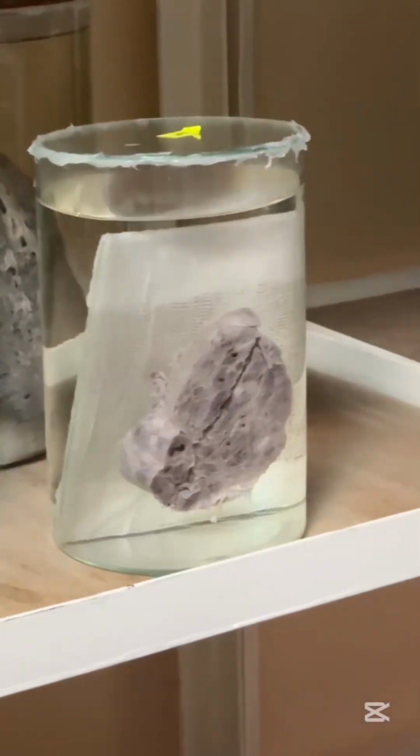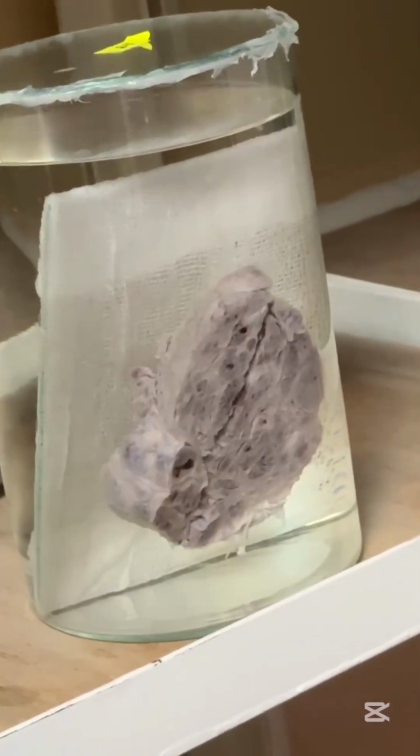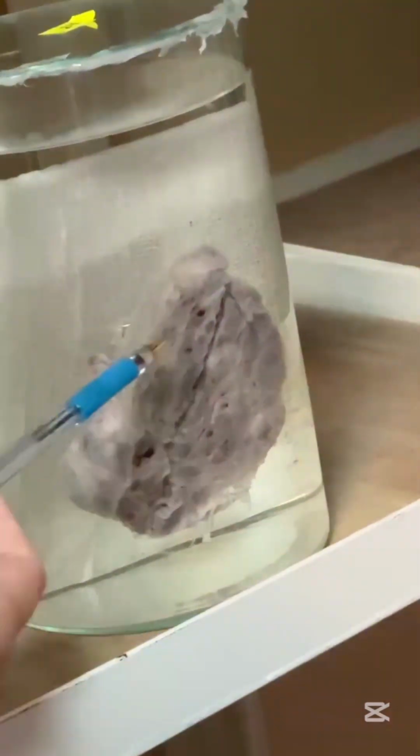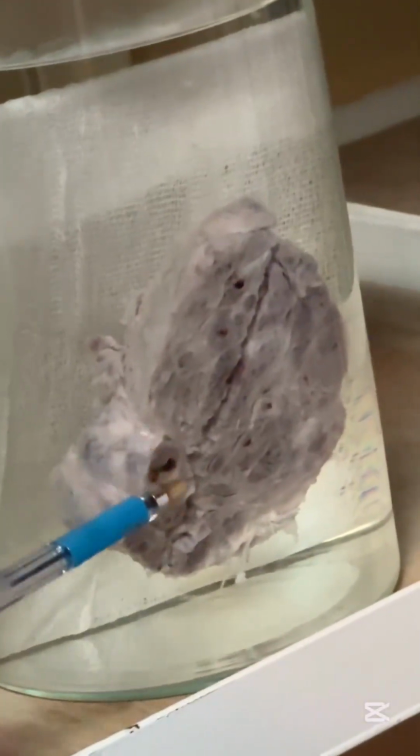That one is goiter, thyroid gland. It is enlarged, that's why we called it goiter, and you can see multiple nodules on the cut surface, so that is nodular goiter because of nodules. In some areas, dark brown colloid, excess of colloid, nodular goiter.